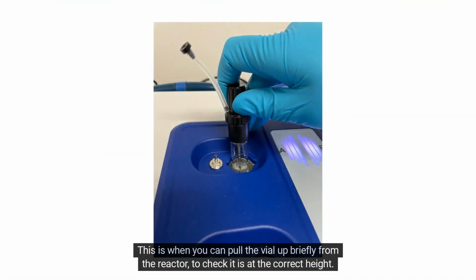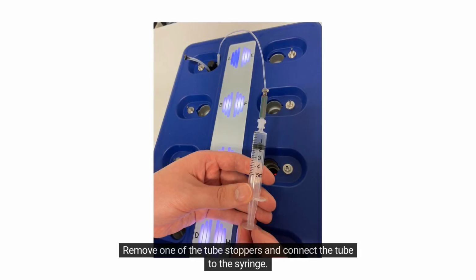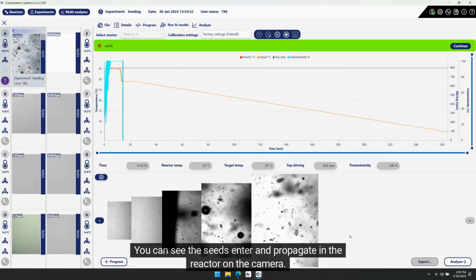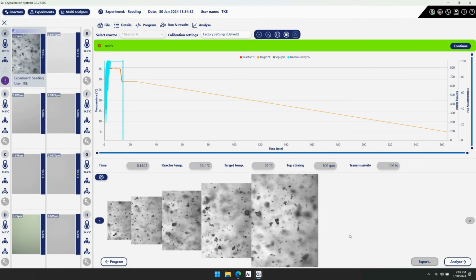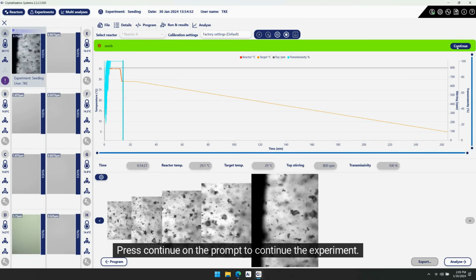This is when you can pull the vial up briefly from the reactor to check it is at the correct height. Remove one of the tube stoppers and connect the tube to the syringe. Then press down on the syringe to push the seeds into the vial that is in the reactor. You can see the seeds enter and propagate in the reactor on the camera. Press Continue on the prompt to continue the experiment.